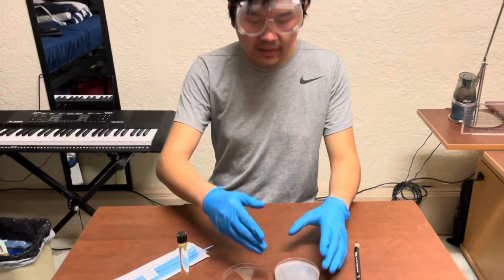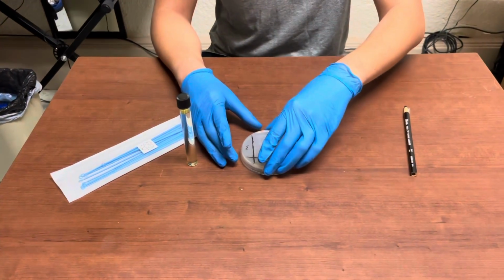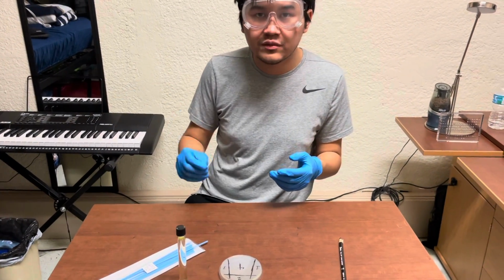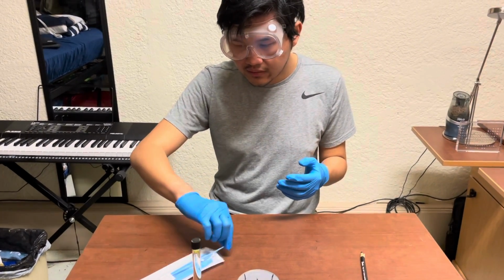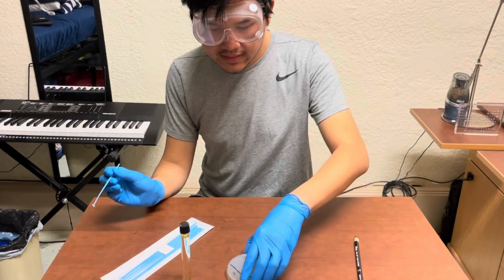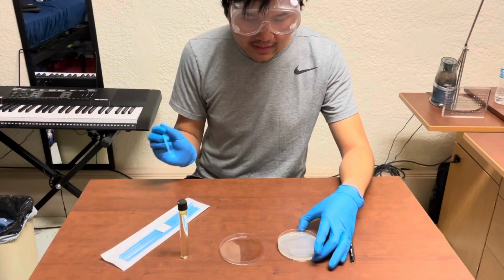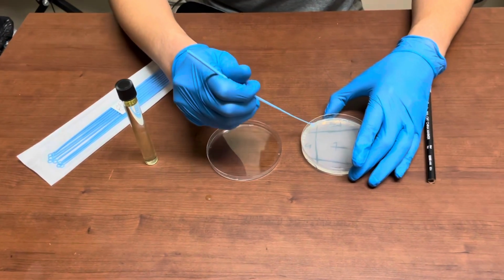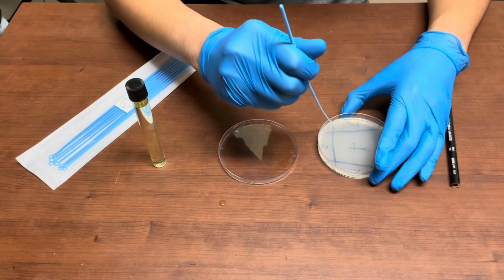If you tear the agar while you're streaking for isolation, that's very bad and will lead to bad outcomes for your experiment. Okay, so now that I've streaked in quadrant 1, I'm going to quickly close the agar plate before it gets more contaminated. I've disposed of the plastic inoculation loop I used to streak quadrant 1, and now I'll take another plastic inoculation loop that's sterile. I'm going to rotate this 90 degrees counterclockwise, and I'm going to open the agar plate, and going from the corner of quadrant 1 to the corner of quadrant 2, I'm going to directionally streak like so.